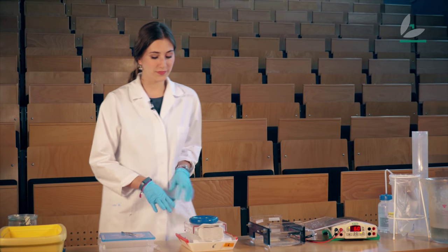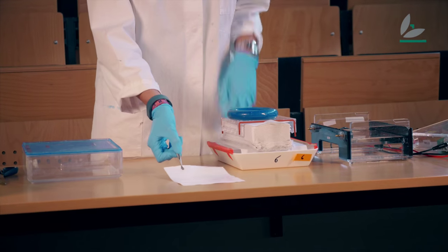So this runs overnight and then at the end I have a foil like this one where the DNA fragments are already on it, but we cannot see them.